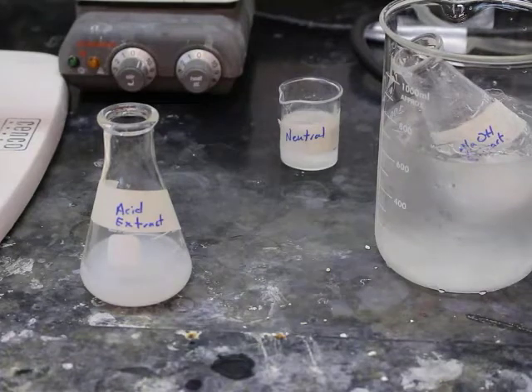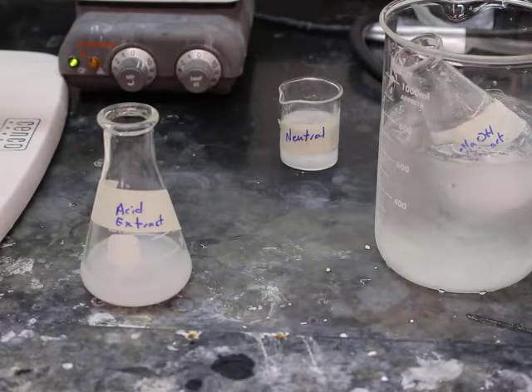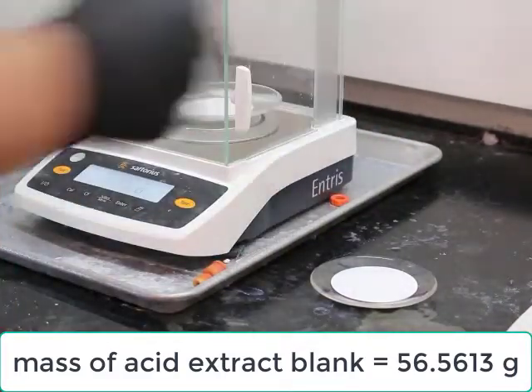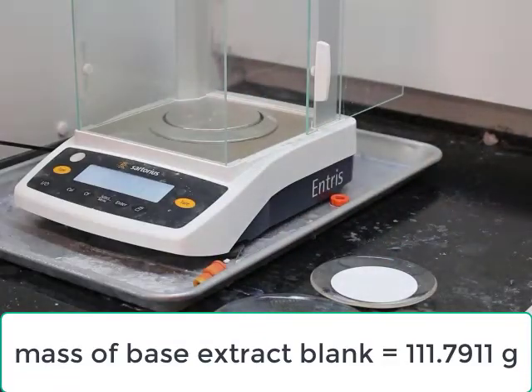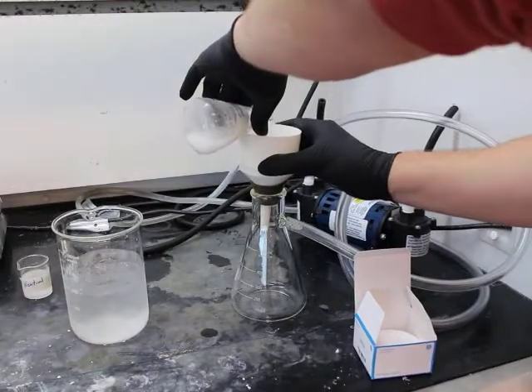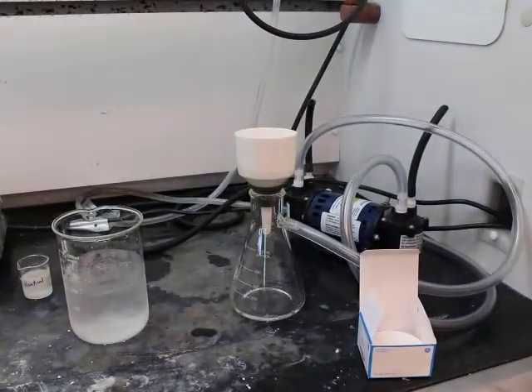All right, so now that we have both of our solids, going to weigh out our watch glass and filter paper so that we can do a vacuum filtration. First up, we're going to look at the mass obtained for the acid extract blank. So 56.5613 grams. Then the mass of our base extract blank was 111.7911 grams.